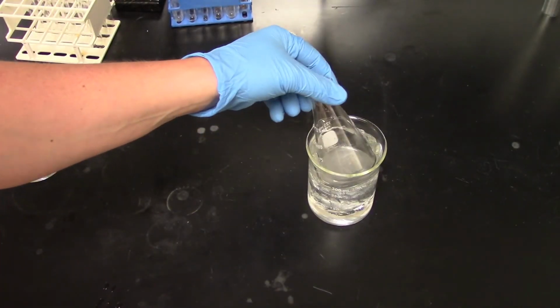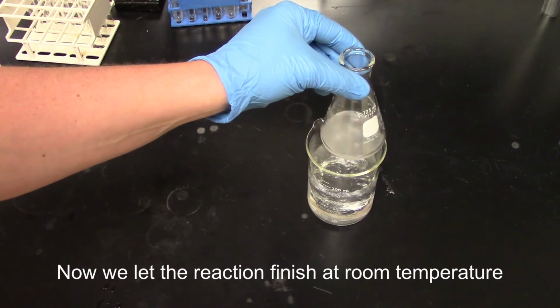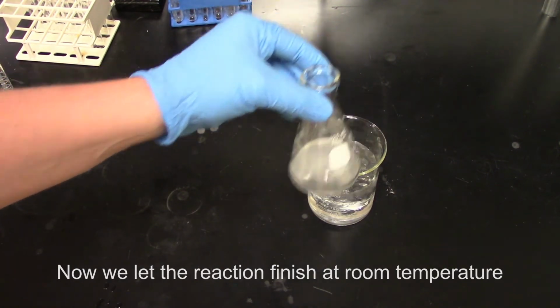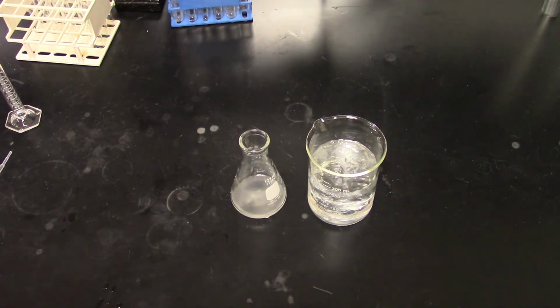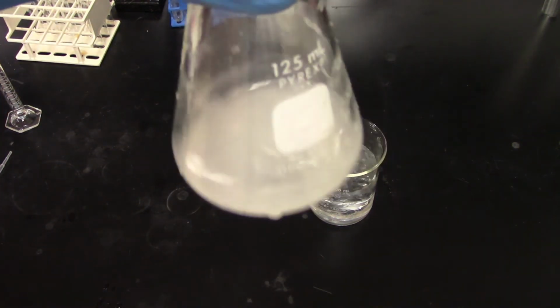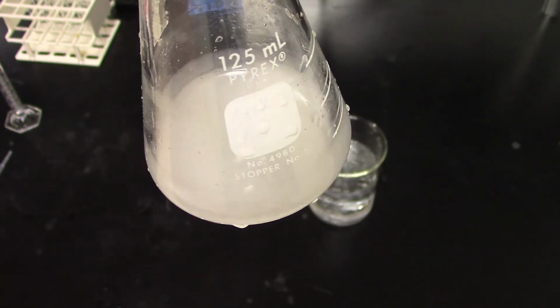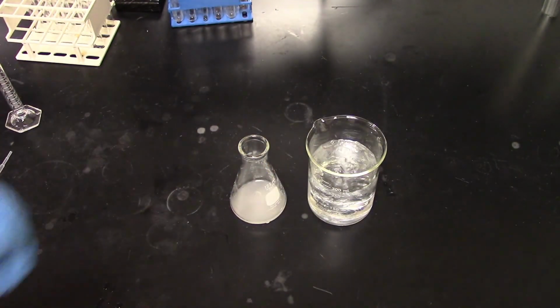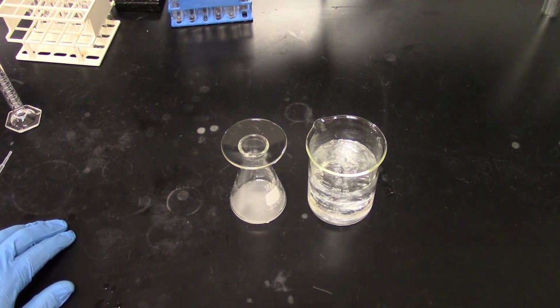All right, we've been reacting for 5 minutes now. We've formed pretty much all the hypochlorous acid we can make with this. So we're going to take it out of the ice bath, cap it, and you can already see our product trying to come out of solution. We're hovering here with just enough acetone to keep it dissolved, and as I swirl it and thin it out, you'll begin to see it turn white and foggy from the product trying to condense back out. But we're going to leave it at room temperature for 15 minutes, and this should give the hypochlorous acid plenty of time to react with our starting alcohol to convert it to a ketone.